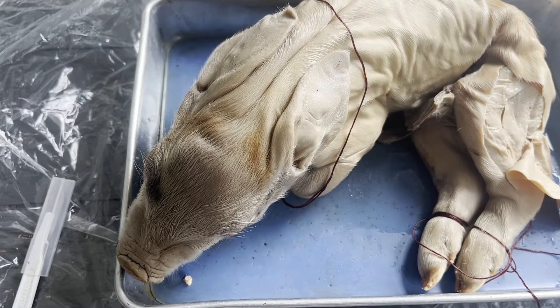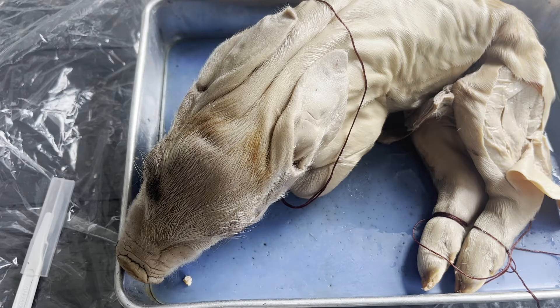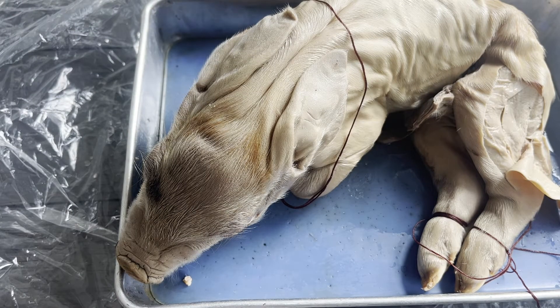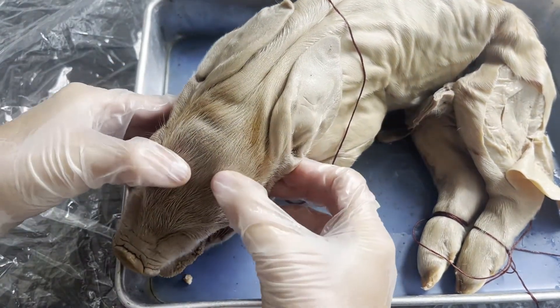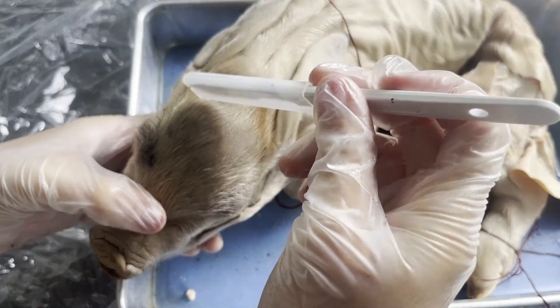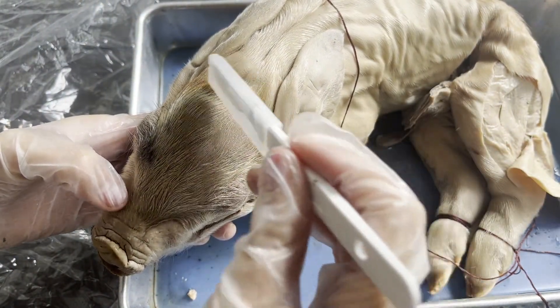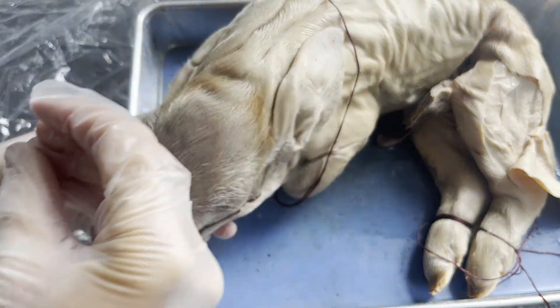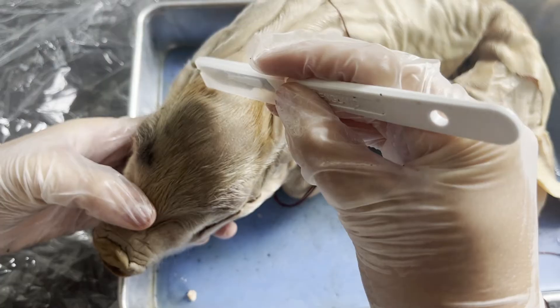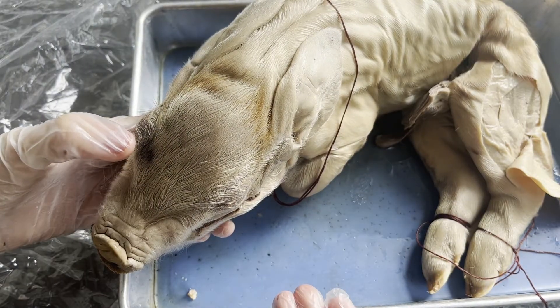My fetal pig was just about to be born when it was harvested, so it's going to be a lot more ossified and have a lot more bone than a fetal pig harvested at seven or eight inches long — this pig is about 16 to 17 inches long. I'm not going to be able to do this next part because my pig has a pretty hard skull. If you have a smaller fetal pig, you can use the scalpel to cut a circle right above the eyes, in front of the ears, and right behind the snout on the top of the head — almost like a little cap — then peel back the skin. If your pig is softer, you can actually cut straight through the skull and lift it back to see the brain tissue.